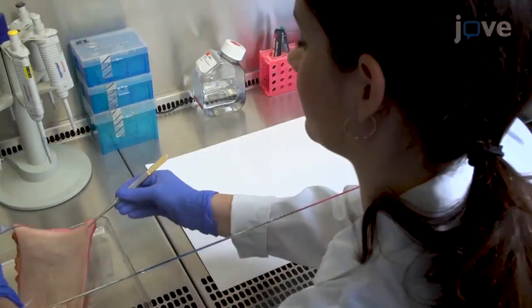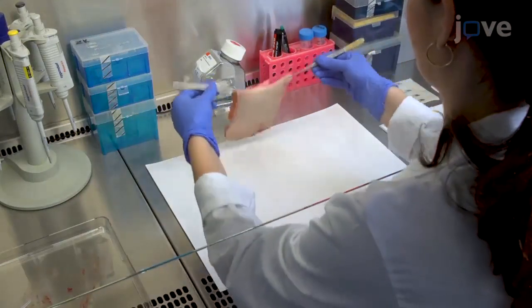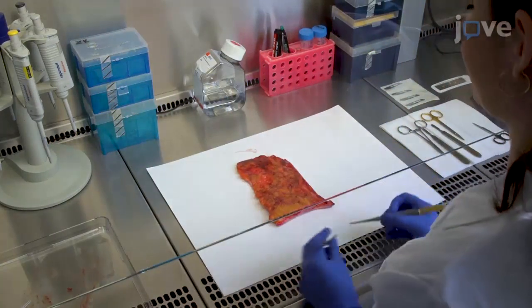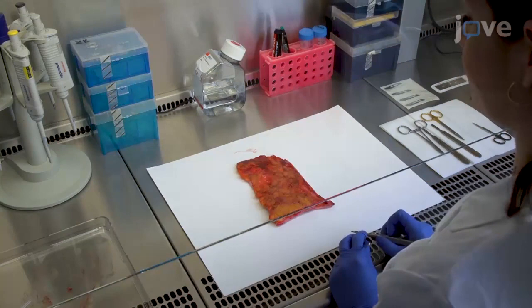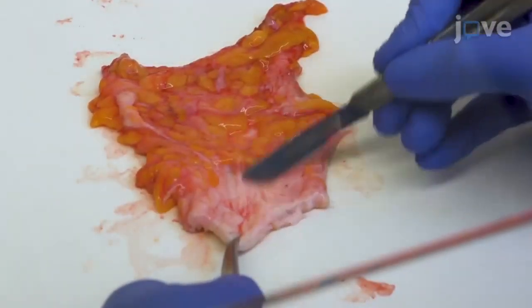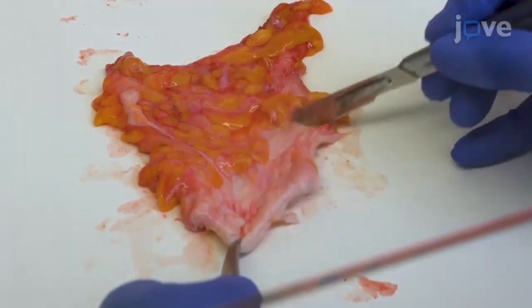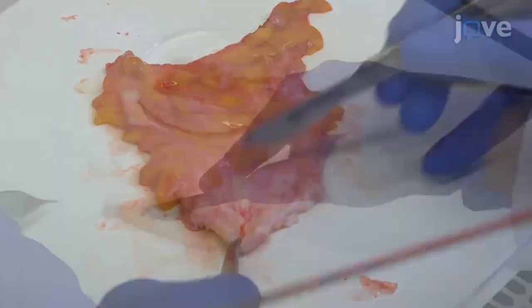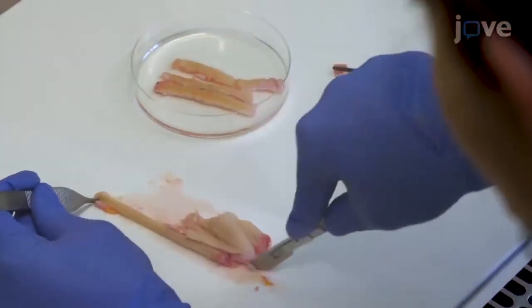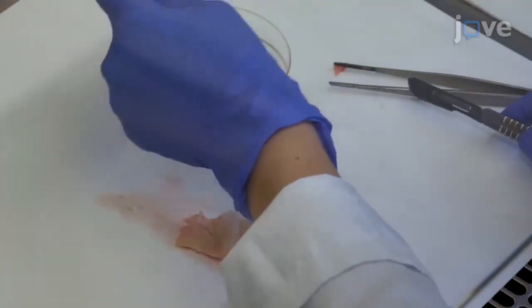To prepare full thickness dermis, place a piece of human skin on a thick filter paper with the epidermis facing downwards. Hold the epidermis tightly with forceps and scrape off the subcutaneous fat layer with a scalpel. Then slice the tissue into 5 mm wide strips before putting them into a petri dish.